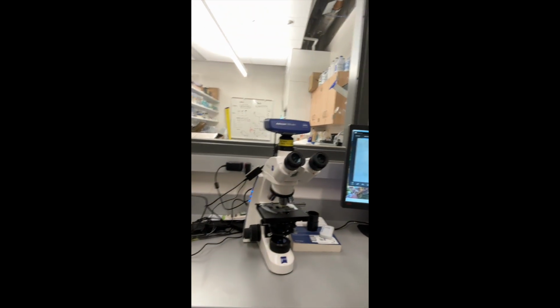So we got this thing, big old Primo Star. We got an Axio 208 color cam on it. I don't know if you guys need to know that, but yeah. I'm going to show you, we have to do this every time we use this just to make sure we get the right light projection onto the otoliths that I analyze. That's my main job. Yeah, so I'll walk you guys through it.